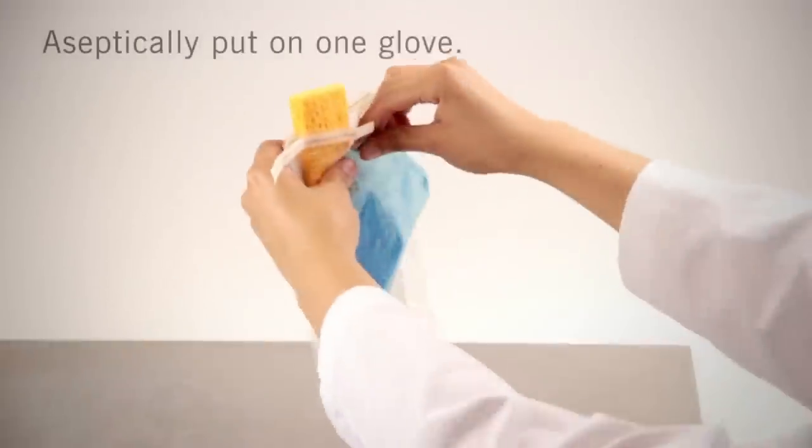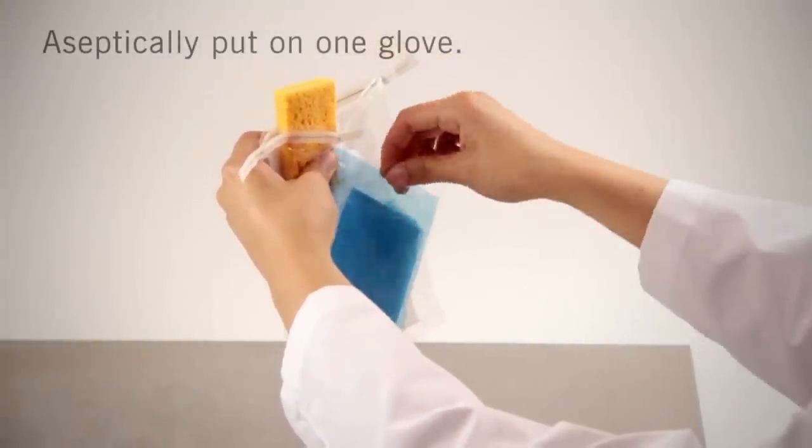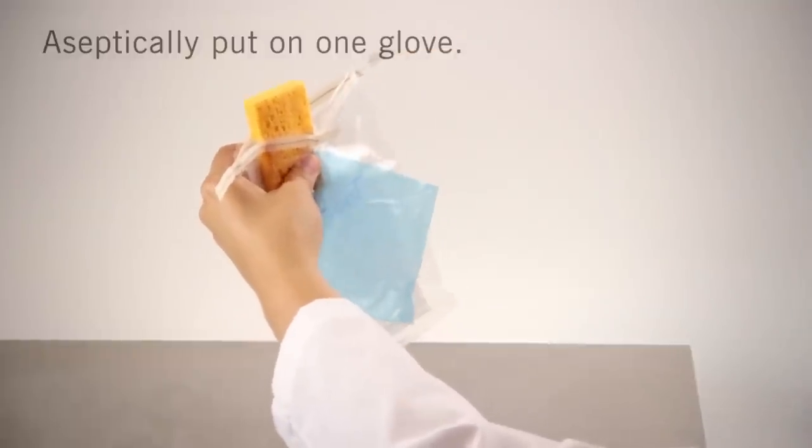If gloves are included, aseptically put on the gloves. If you did not purchase gloves from Hygiena, use a single-use sterile glove.